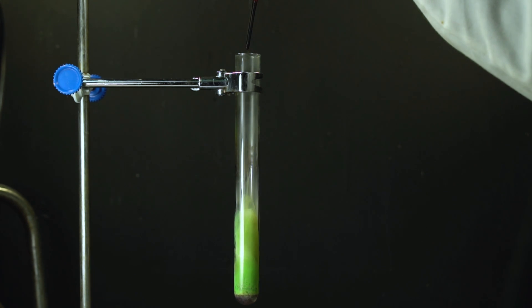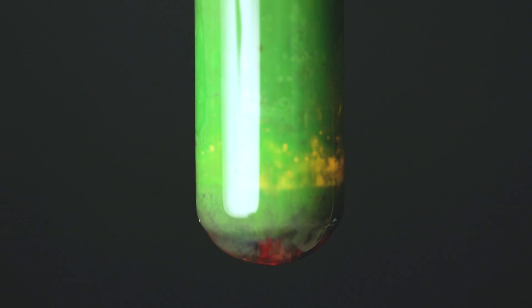Notice how the stain changes when hydrazine hydrate interacts with chromyl chloride. But what is produced in this reaction? Share your guesses with me in the comment section below.